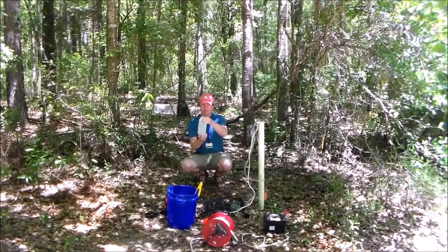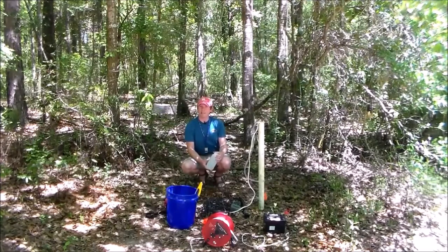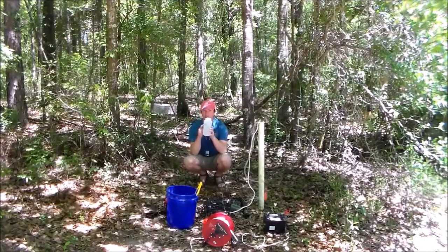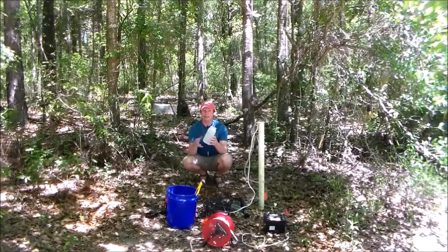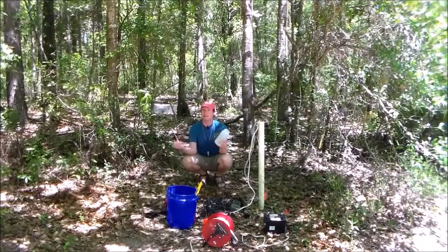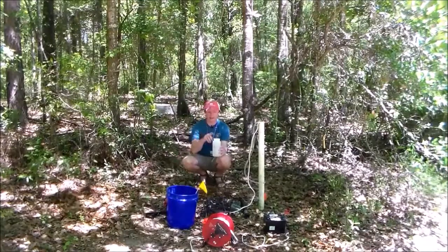If I was sampling for something like benzene, we've talked about it before, or maybe trichloroethylene, those are volatile organic compounds, what we call VOCs. So if I put them inside of a sampling bottle, and I had a big air bubble or something like that, it's possible, and actually it's likely, that some of that benzene, some of that TCE, some of that VOC, in other words, will actually volatilize. It will evaporate from your water sample and enter into the bubbles.